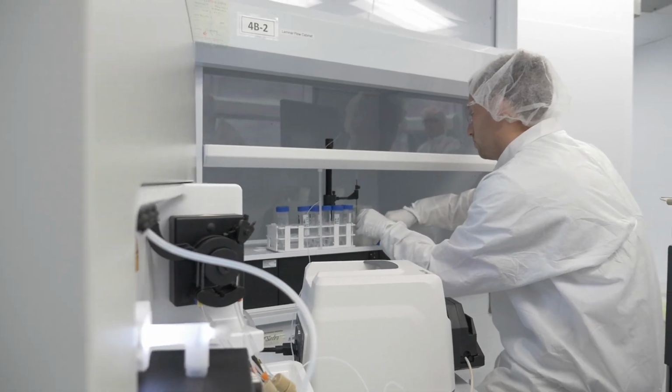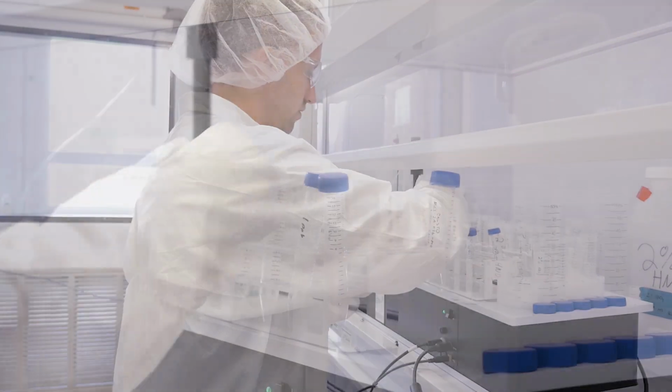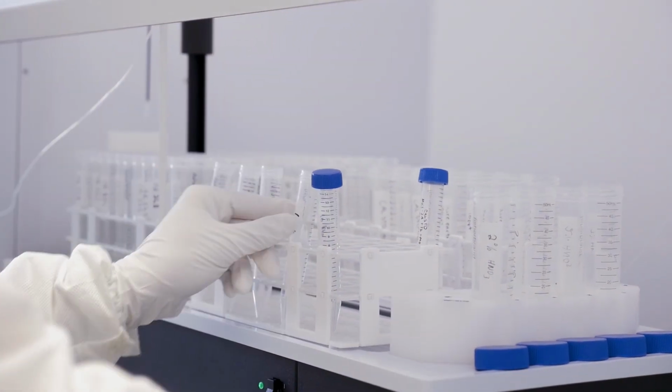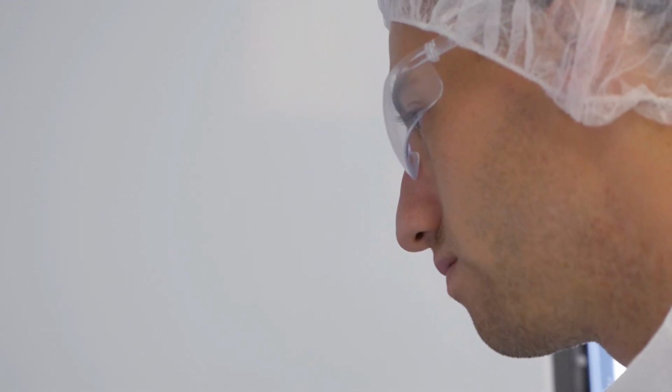Whatever sampling container we use, we clean that before use, even if that is brand new. The protocols and the trace elements level that we can measure in the swamp lab at PPT range, nanogram per liter, which is really very, very low. And in the swamp lab, we are able to measure at that level.